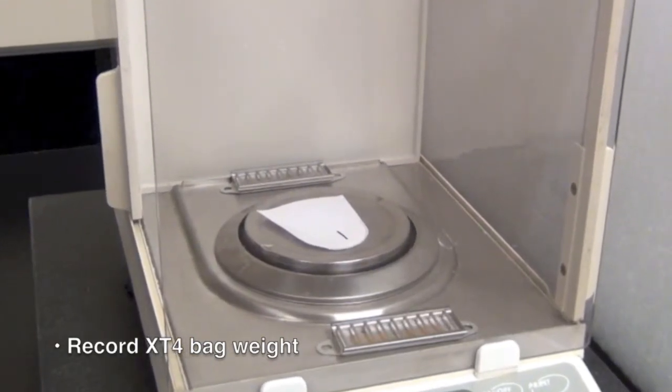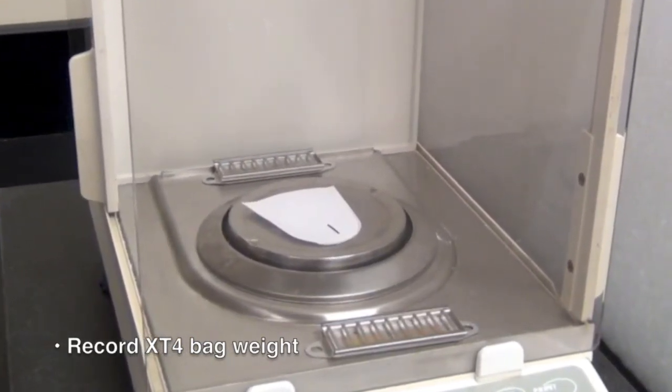Prior to processing the sample, record the weight of the XT4 filter bag.